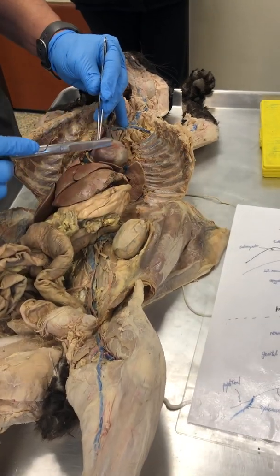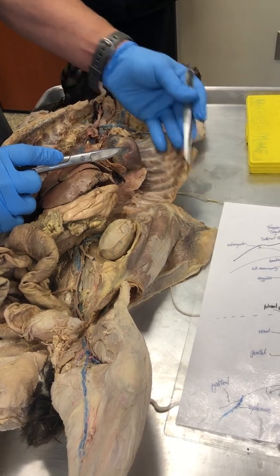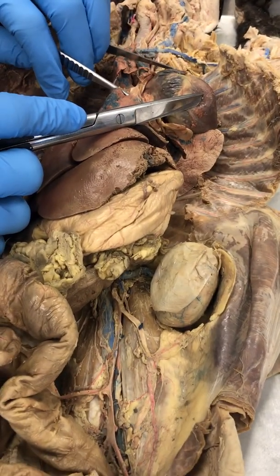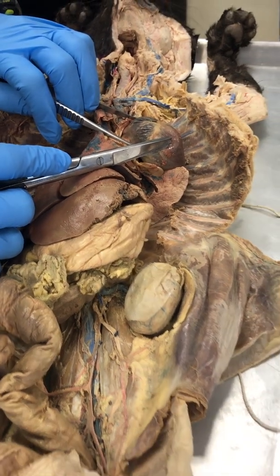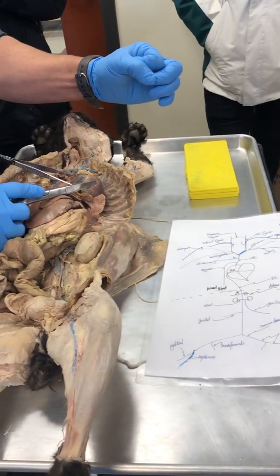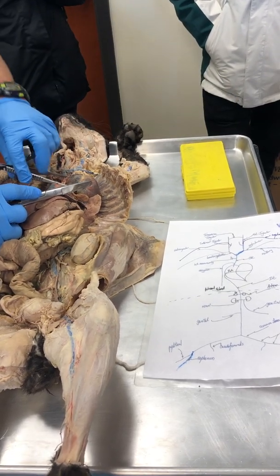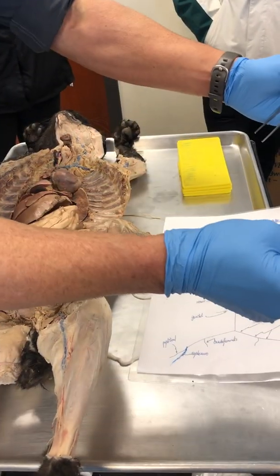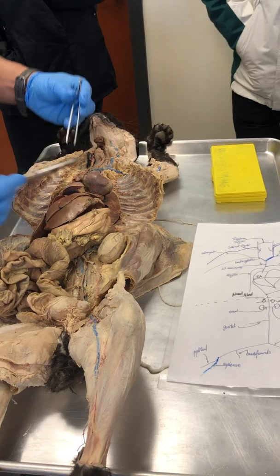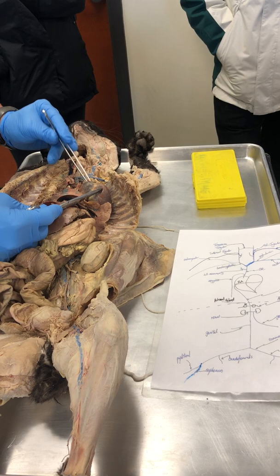So there's the heart. All right? And notice how distended this right atrium is. Come close, you can see how big the right atrium is, compared to the right atrium of the deer heart of last week. That was shriveled up. Now, why was it shrunken down like that? Because the deer hunter cut the blood vessels, and what happened to all of the blood? It drained out. So this right here is a stretched right atrium. All of this is the stretched right atrium muscle.